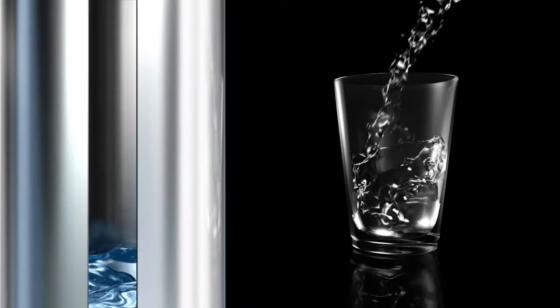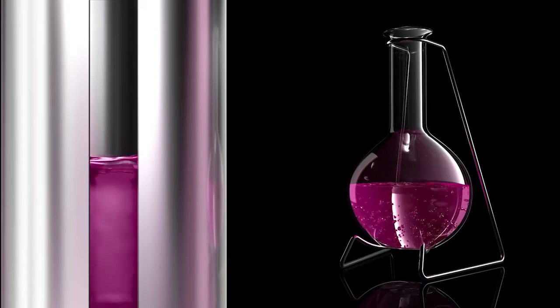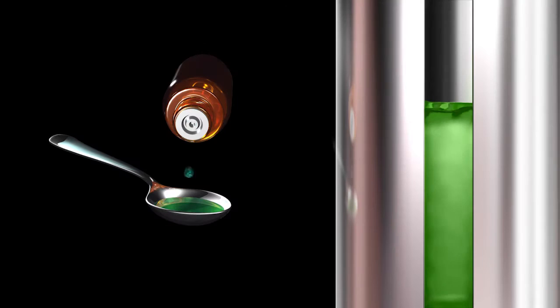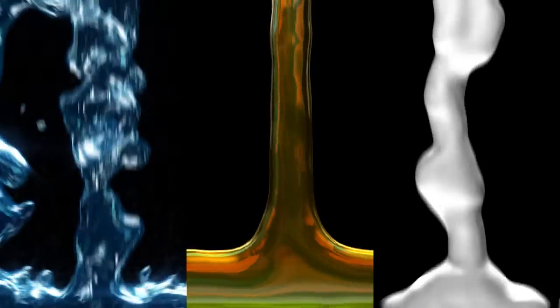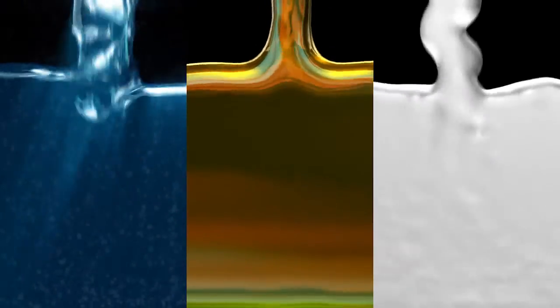Many liquids are essential in our daily life. They may include water, beverages, dairy products, chemicals, acids and bases, or pharmaceutical products. The quality of these liquids is determined by their chemical and physical properties. To assess these properties, various principles of measurement are used. One of these principles is the measurement of electrical conductivity.